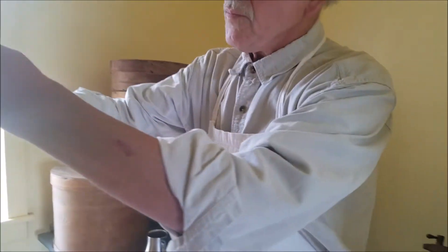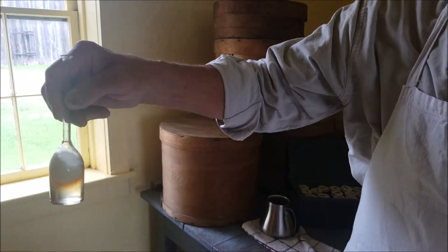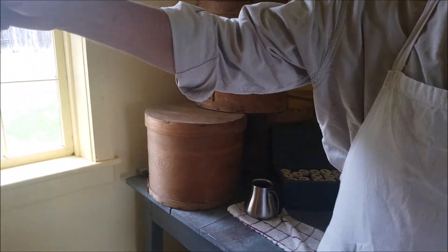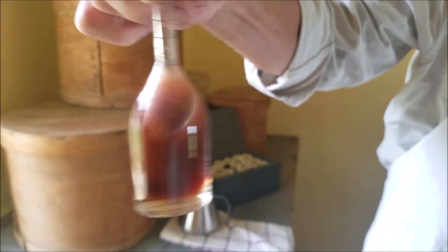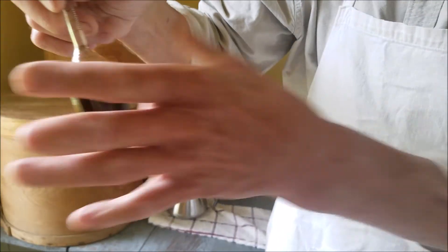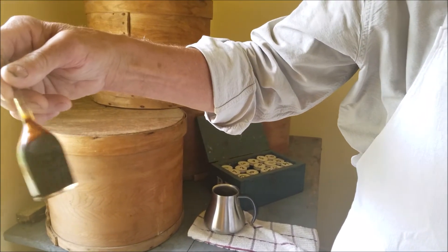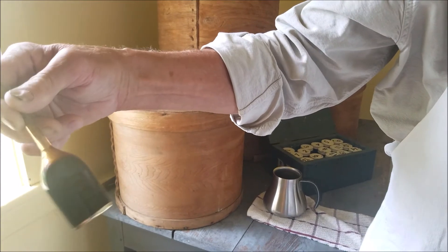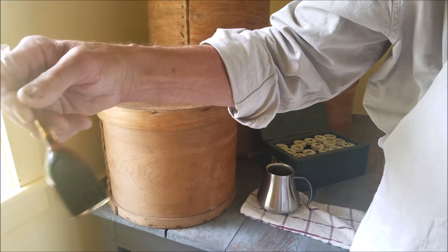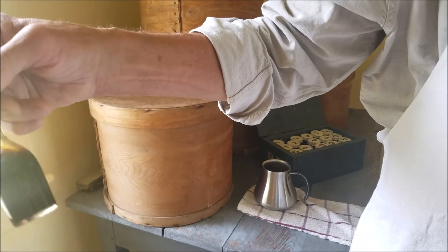So now it went to the bottom. We're going to slightly shake it — just get it a little mixed in. I don't want all this milk going up right away; I want it to stay down below. You can see the colors changing — it's starting to dissolve the proteins and casein, and calcium as well. See, it gets to over 140 degrees; the reaction is so great. You always want to point your vial test bottle away from everybody because it could come out once in a while. Get this stirred up good to make sure it's all dissolved before we start the centrifuge.